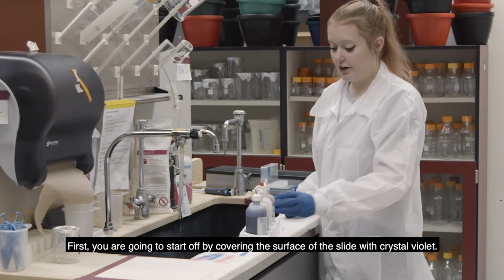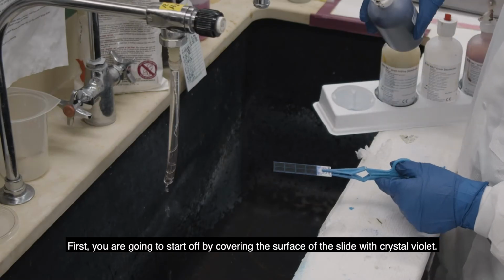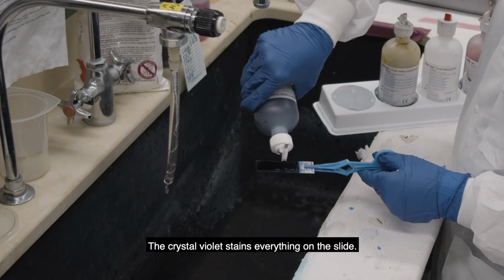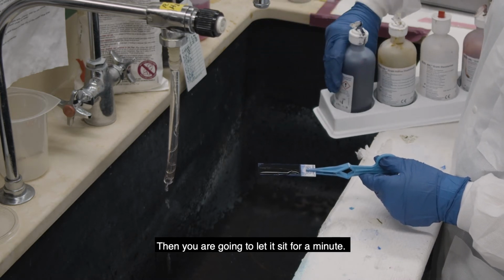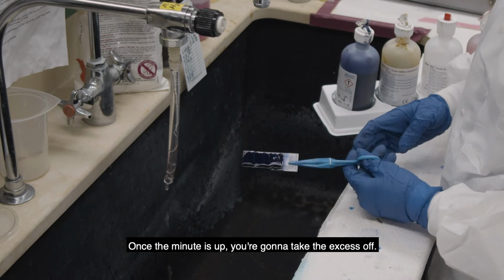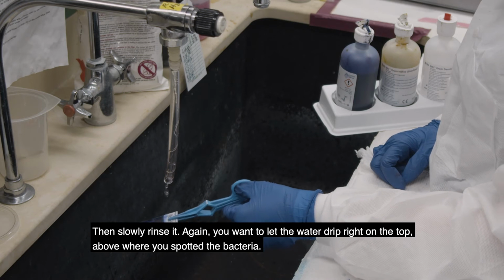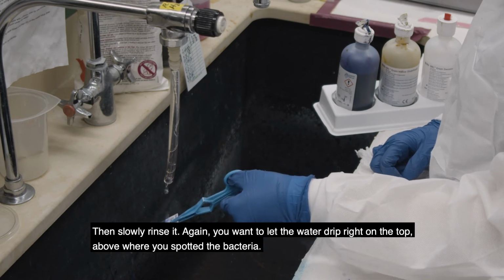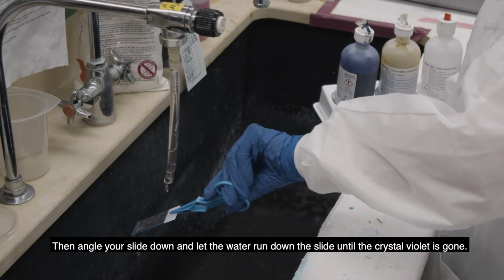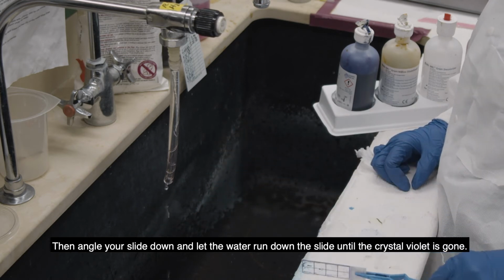So first you're going to start off by covering the surface of the slide with crystal violet, and the crystal violet just stains everything on the slide, and then you're going to let it sit for a minute. Then once a minute is up, you're going to take the excess off and then slowly rinse it, and again you want to let the water drip right on the top above where you spotted the bacteria, and then angle your slide down and let the water run down the slide until the crystal violet is gone.